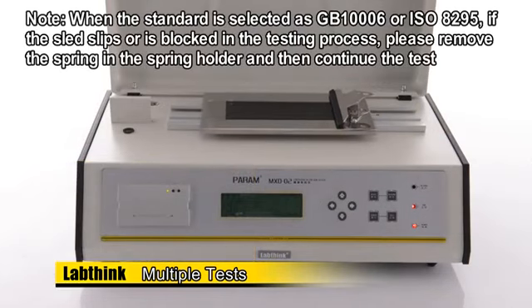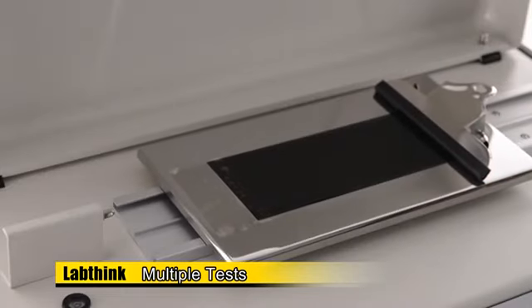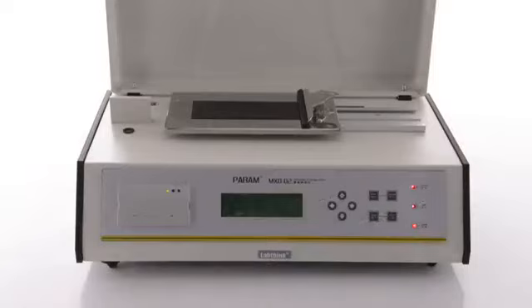Press Return so that the test platform will be returned to its original position, and when the indicator light on the right side of the instrument is on, it will stop. Continue to test other specimens according to the procedures above.